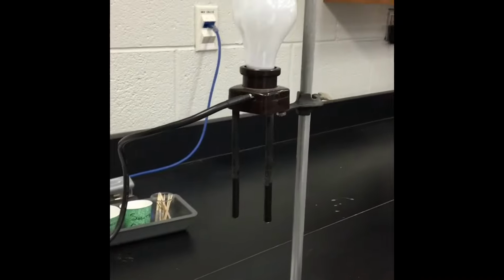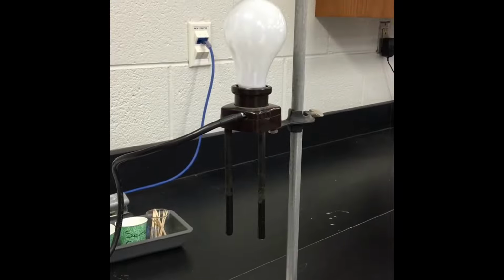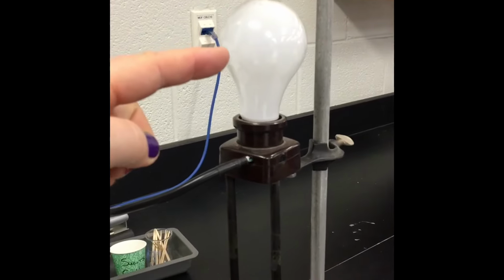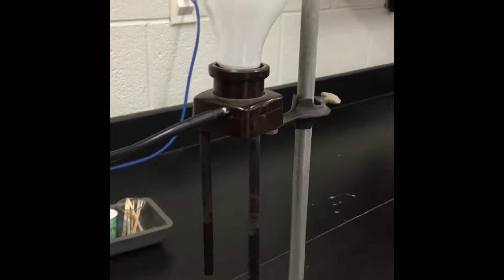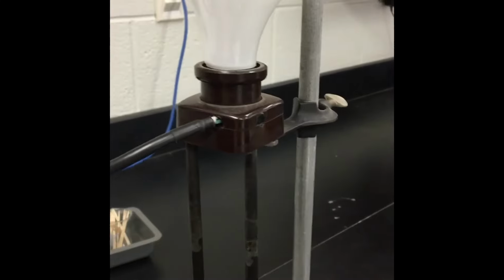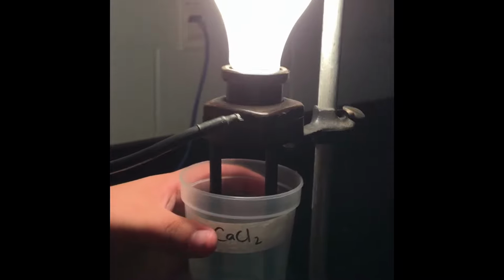Next, we're going to test conductivity. If they are ionic and they are dissolved in water, then they should be very good conductors of electricity. And we're going to test this because we have a light bulb. So if the light bulb lights up very bright, then that tells me the compound is ionic. So this light bulb is connected to 2 electrodes, and we have dissolved our substances in water, and we're going to put that into our electrodes. So lights, please. And calcium chloride is very conductive, I can see, because the light bulb is very bright.